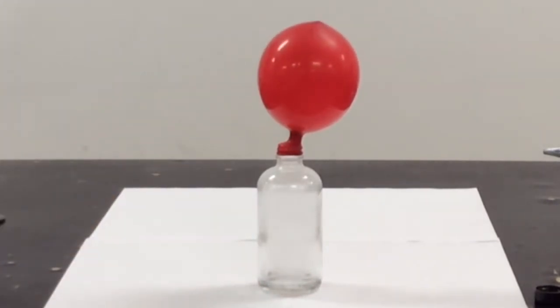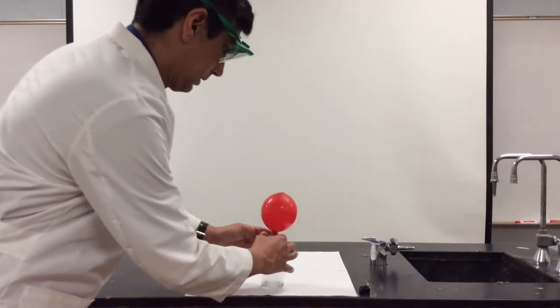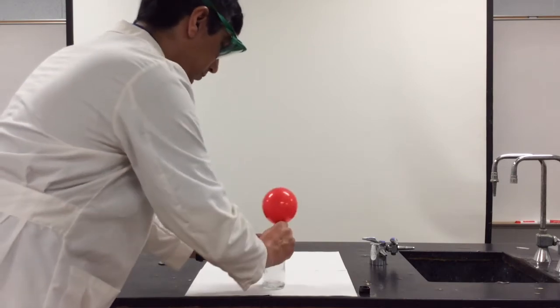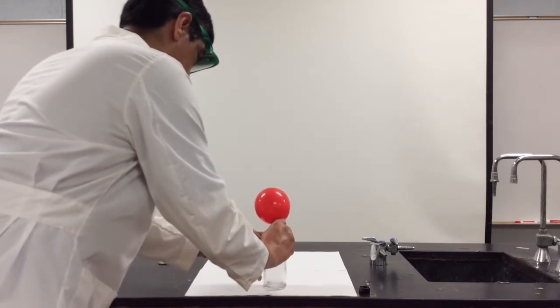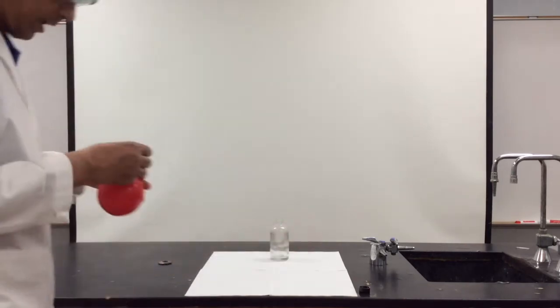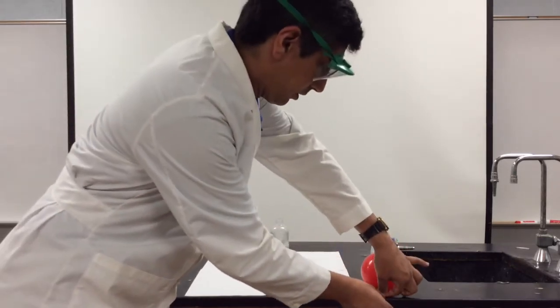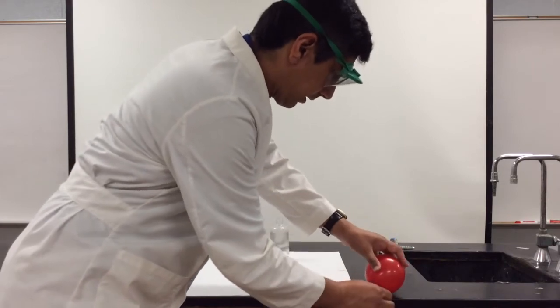Now once I'm satisfied that I have enough hydrogen gas I'm going to tie off this balloon and let's see what happens when we react this hydrogen with oxygen in the air.